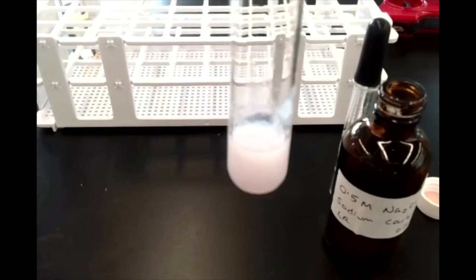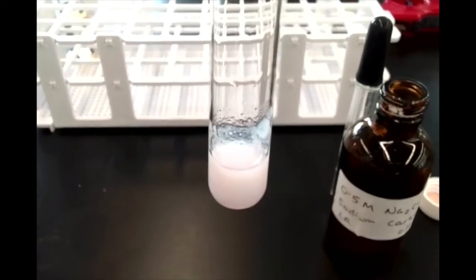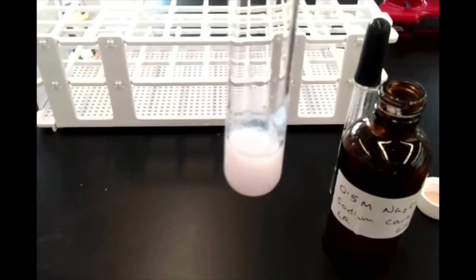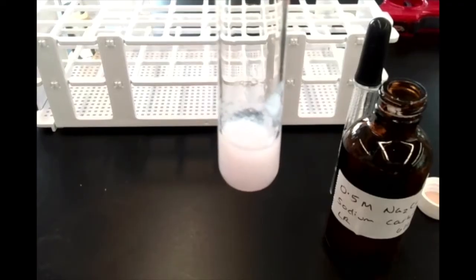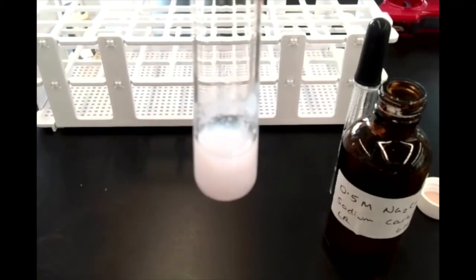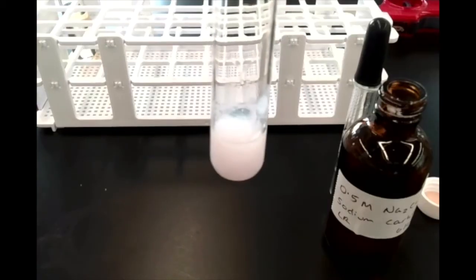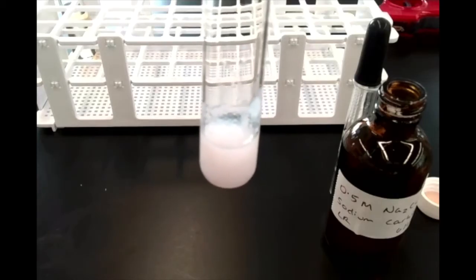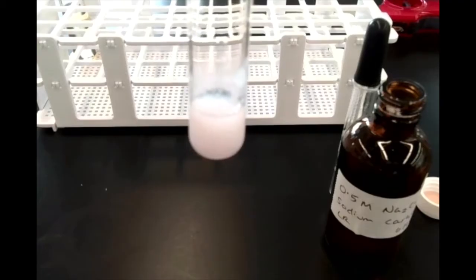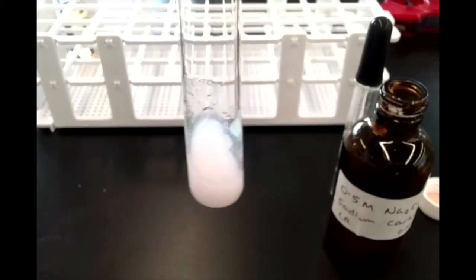So the calcium ions from our calcium chloride and the carbonate from our sodium carbonate combine to form calcium carbonate. Now, calcium carbonate is not a water-soluble salt. It crashes out as a solid, the white solid that we're seeing, actually. Calcium carbonate's the main ingredient in chalk and marble and limestone and things like that. So it's a white, chalky solid that's not water-soluble, and that's the stuff we see here.